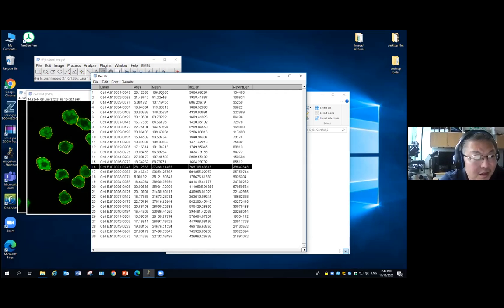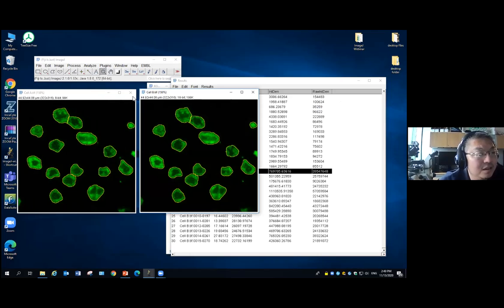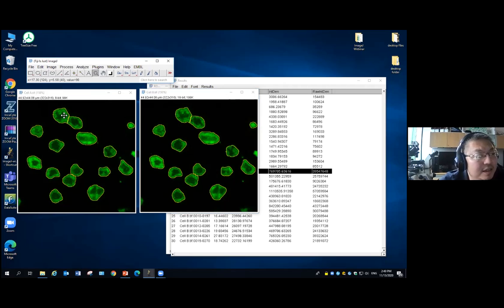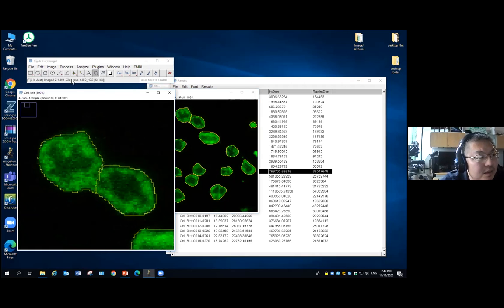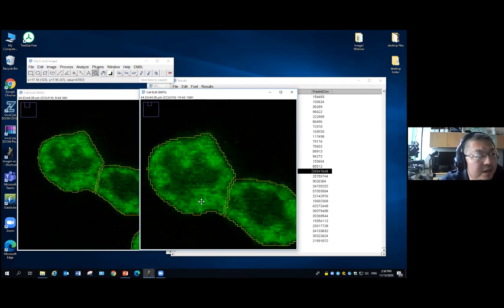The reason is, when you see the image, it doesn't really look much different. But if you check the image here, this image is an 8-bit image, and cell B is a 16-bit image. By definition, in an 8-bit image the intensity level is between 0 and 255. If I move to the cell here and check the pixel intensity, it is about 130 to 190. But when I go to cell B, the same region, we're looking at about 47,000.